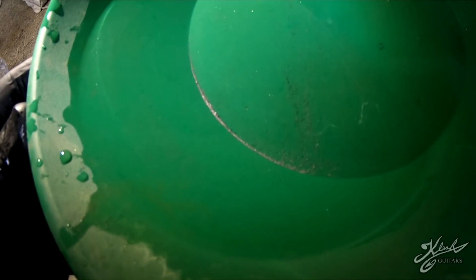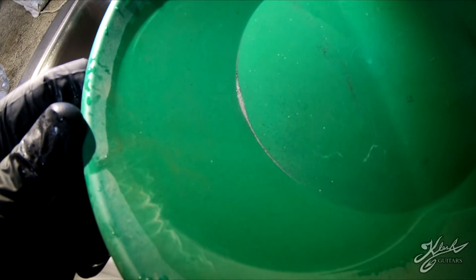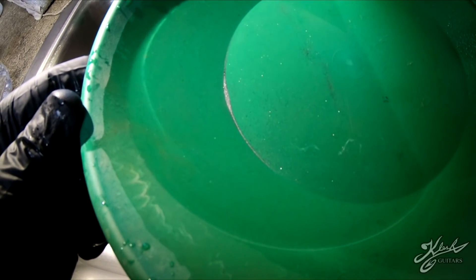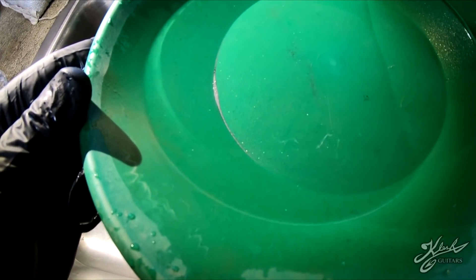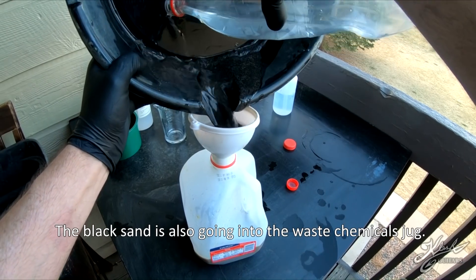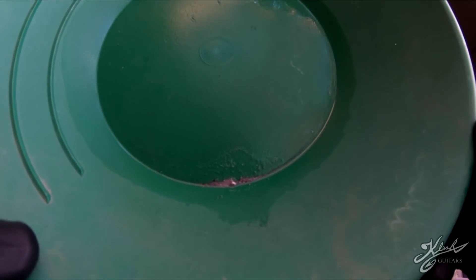You can see we have a nice little line of gold and mercury. So how do we get the gold out? We've got to use some nasty chemicals - and this is the reason why you really don't want to be doing this at home. Let's take it outside and add the nitric acid. This is how much amalgam we have that we're going to process with the nitric acid.